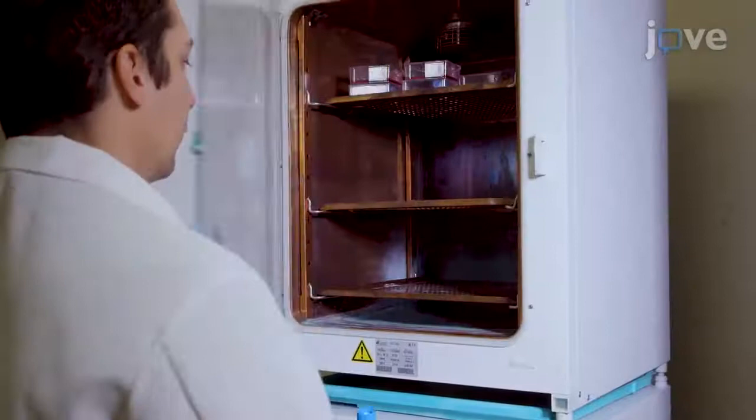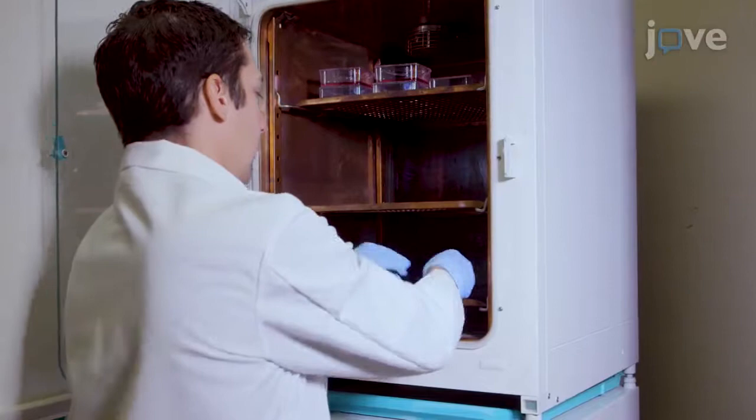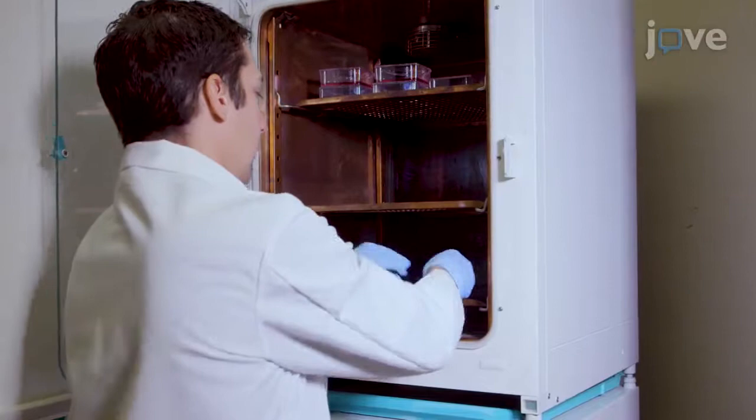Return the flasks to the incubator for a recovery time equal to 1.5 to 2 doubling times, as recommended by the Organization for Economic Cooperation and Development Guidelines. At the end of the recovery period, transfer the cultures into individual 15 mL polypropylene tubes for centrifugation.